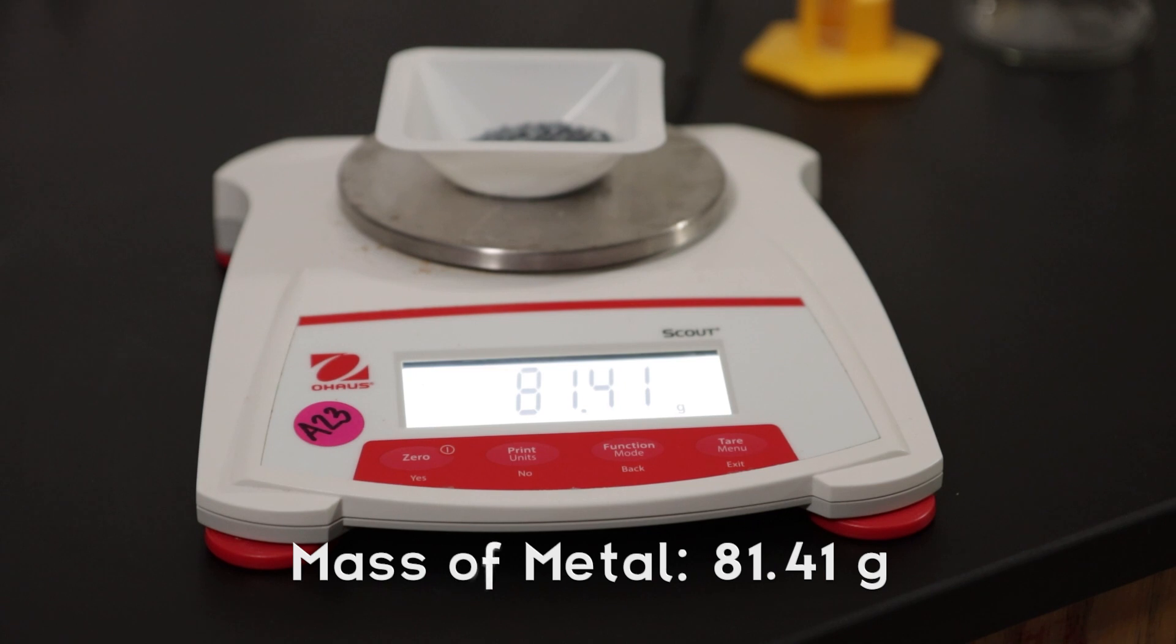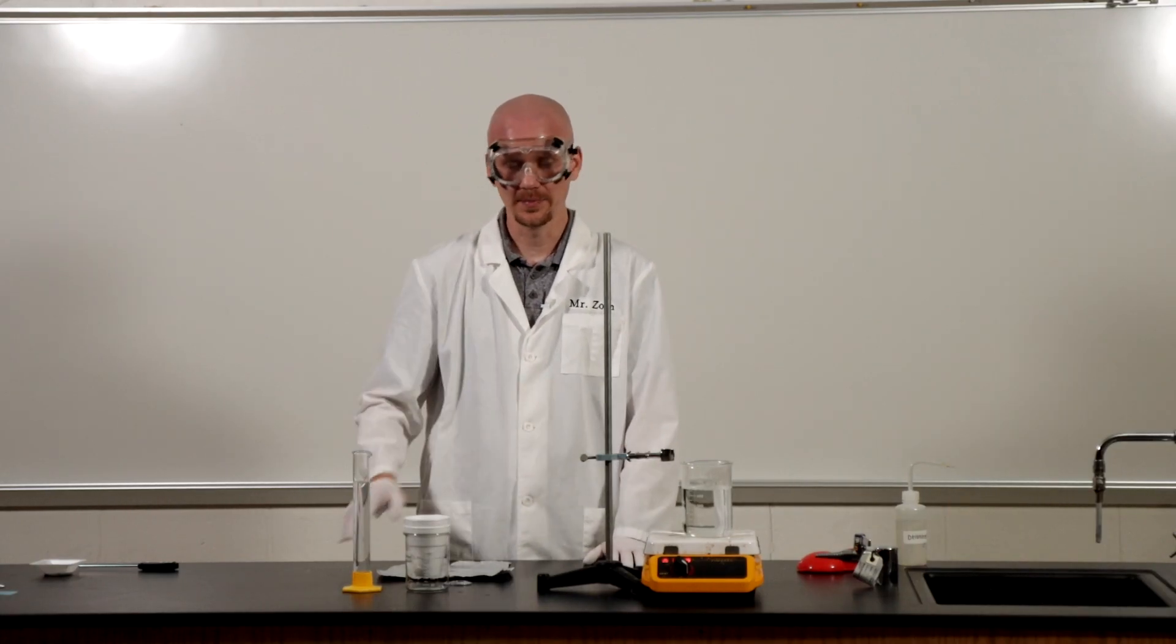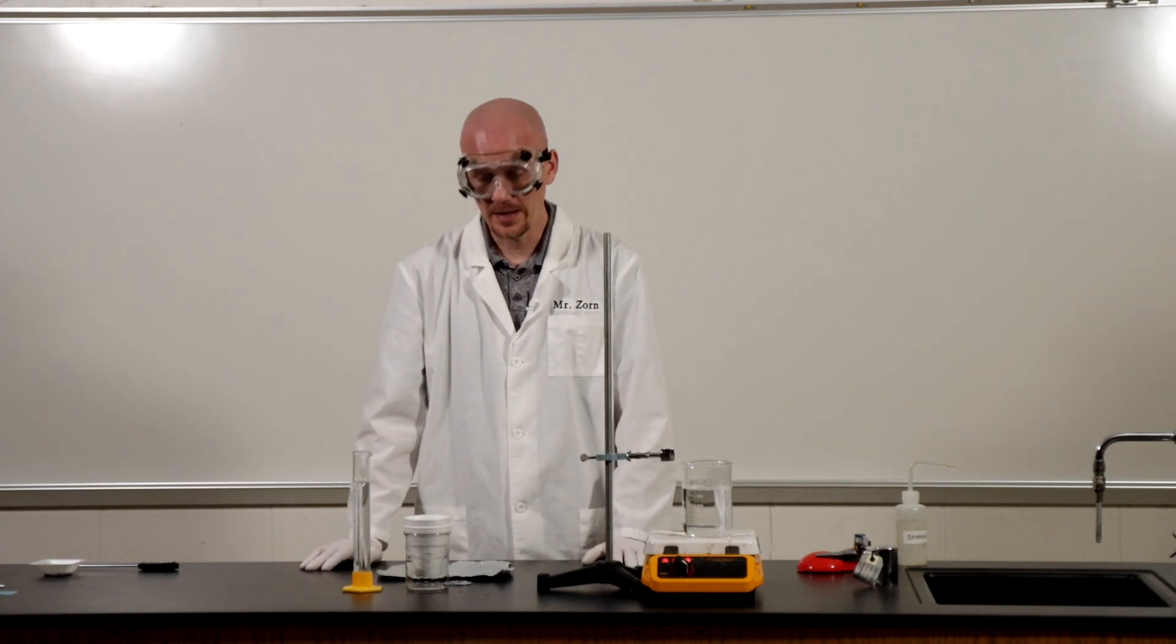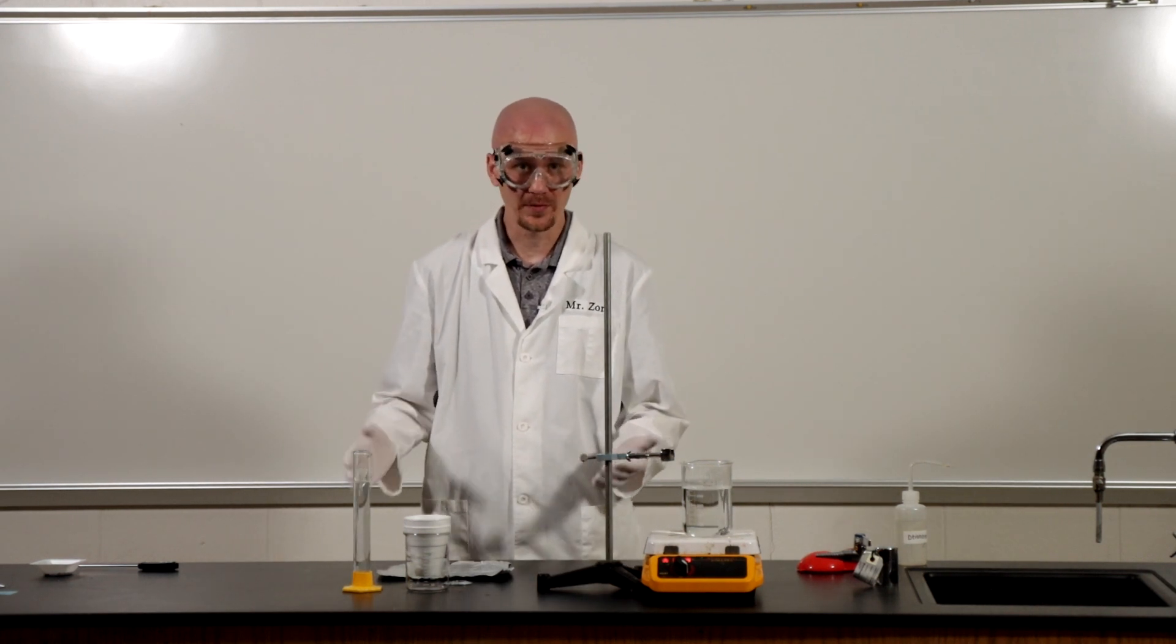Okay, so go ahead and write that number down in your data table. All right, while this is heating up here, which I'll talk about in a second, I want to talk about what a calorimeter is, because you're probably wondering what a calorimeter is.